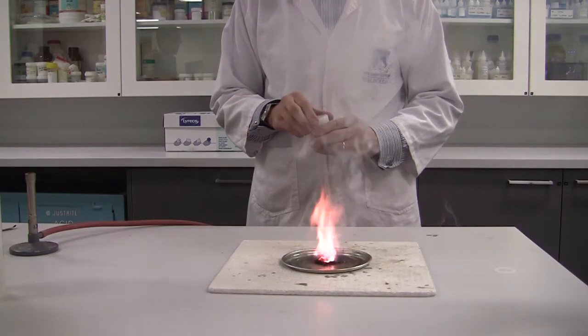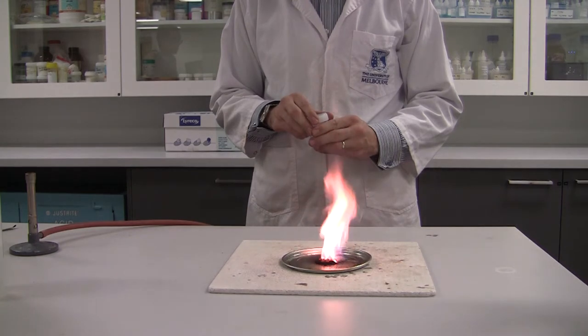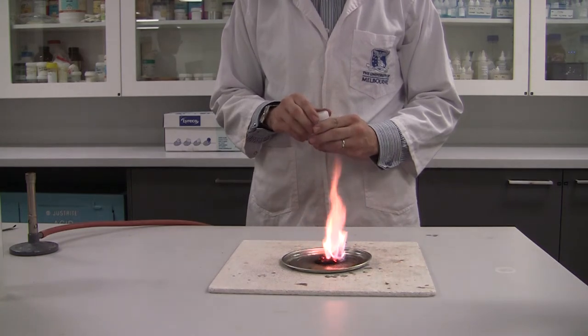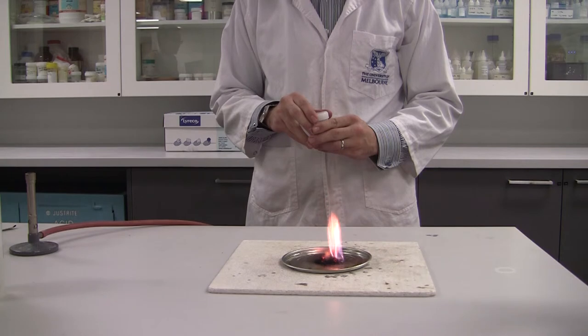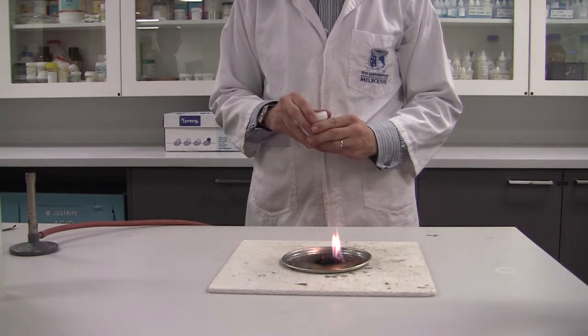It's quite an interesting reaction because there's no ignition source. You can do this in a fume hood by the way, you don't have to but I would do it in a fume hood.